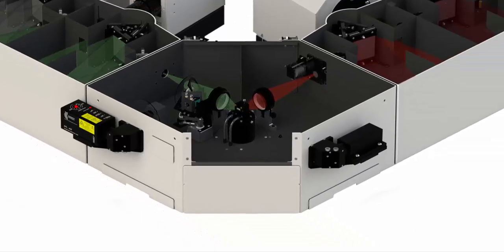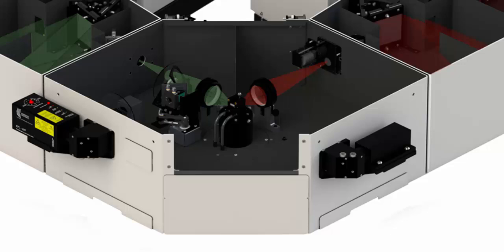The sample chamber shows the excitation path comprising 2 irises, an excitation reference detector, a beam splitter, an excitation quartz doublet lens, cuvette sample holder, and the emission arm shows an emission quartz doublet lens and emission shutter. Also shown are 2 lasers. The left one is for TCSPC and the right one is for steady state or MCS.